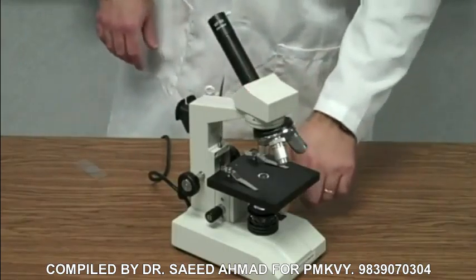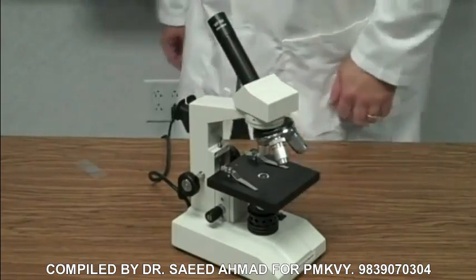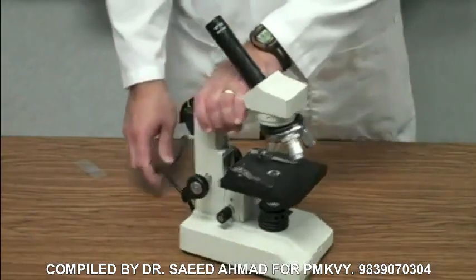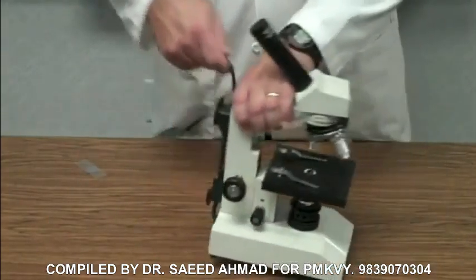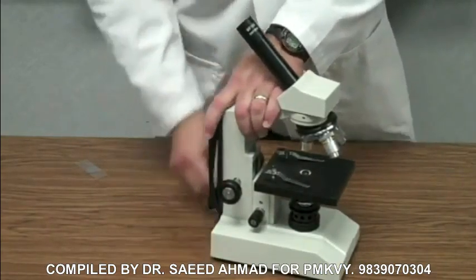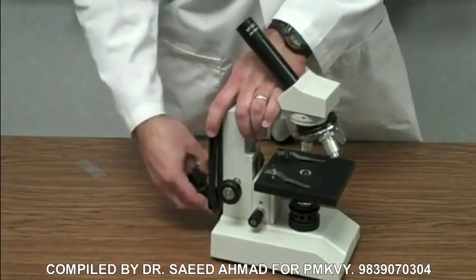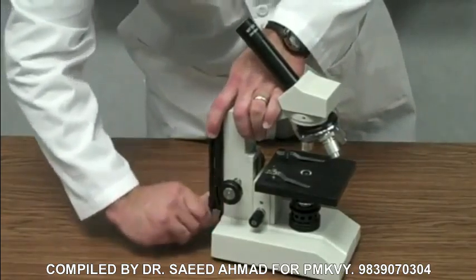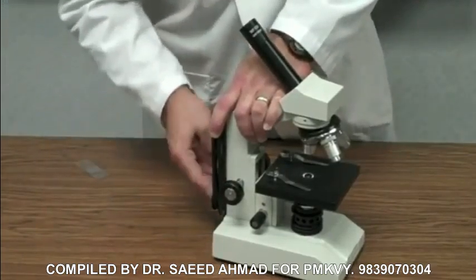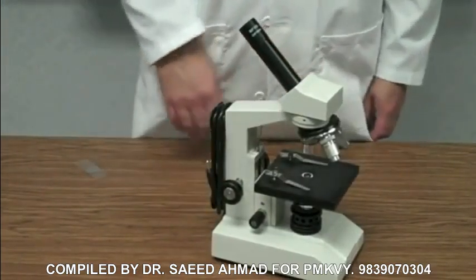Okay? And then obviously turn your light source off. When you unplug, you always grab from the plug, and then there's a nice little place on the back of the microscope where you can wrap the cord around in order to store it. Okay? Most of the times you guys will not have to store it because I'll need it for my other classes and so forth, but if you're the last class of the day or whatever, I may have you store the microscopes for me.